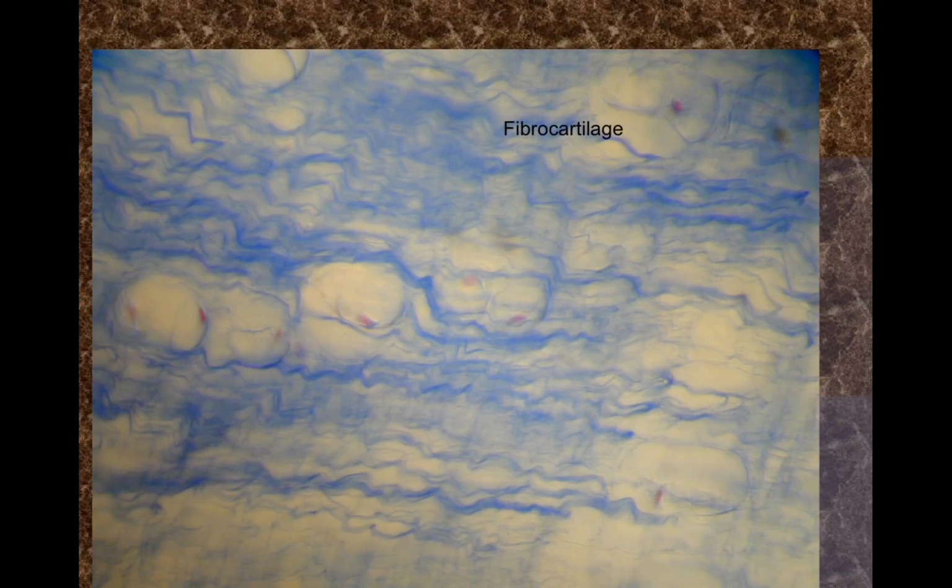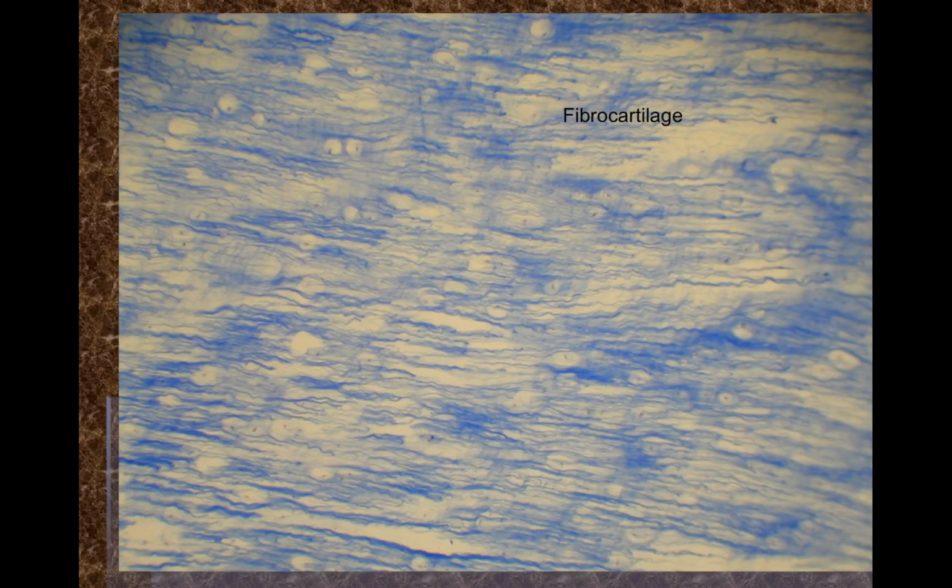The last cartilage is going to be fibrocartilage. Typically in fibrocartilage, the cells are linear, and when the cartilage is aged, we also see kind of a fibrous appearance to the matrix. So this looks like a little bunch of fibers all coming together to form a matrix. Young fibrocartilage, however, is very smooth, looks very much like hyaline cartilage. And there you're going to be looking for the linearity of the chondrocytes.